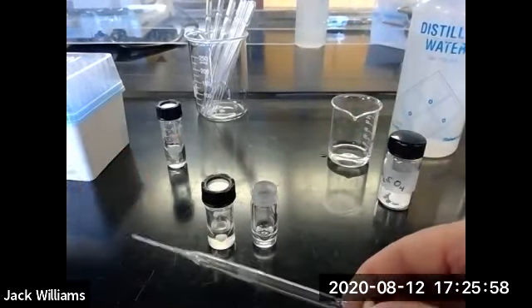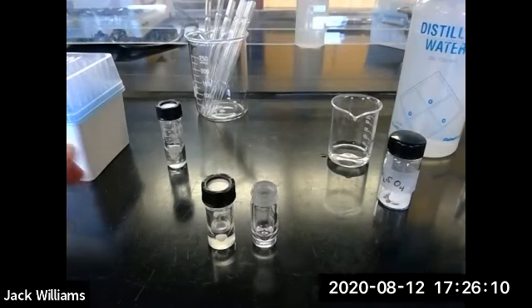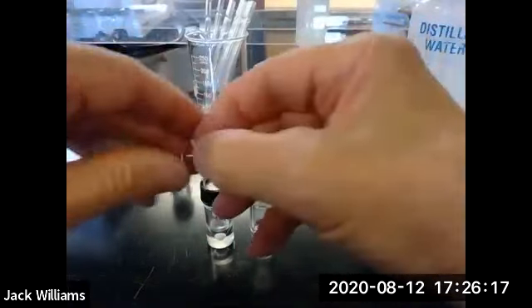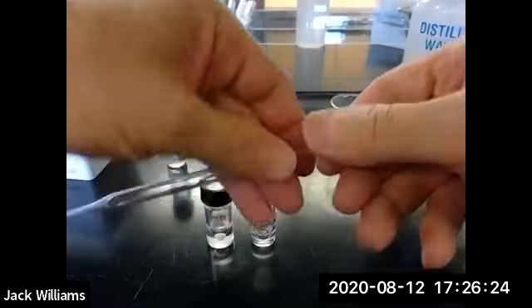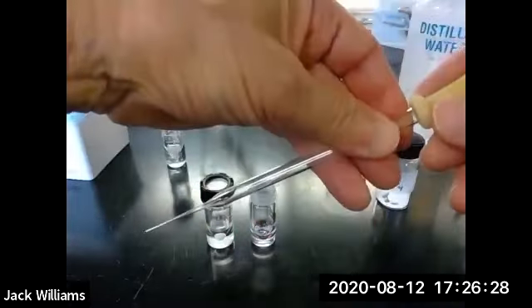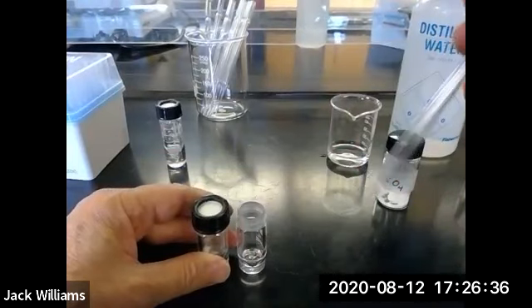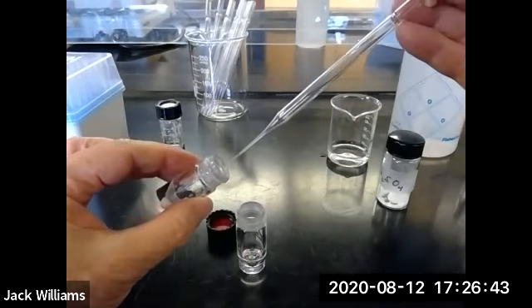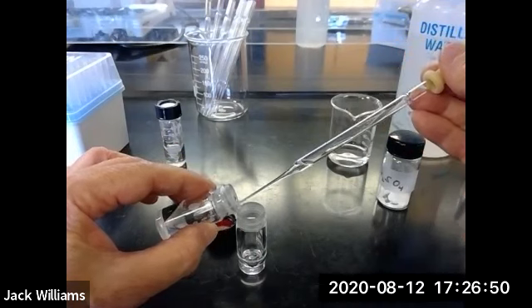We're going to use a Pasteur pipette. You should use a clean one because this has got maybe some water in there. So we'll put this into the waste beaker. Get a fresh, clean one, just be careful handling this. You're going to wear gloves. Just make sure you don't stick yourself with a corner, right? You just work carefully. You won't have a problem. Notice how I'm holding this. I'm not holding it like this, right? You hold it like this so it's pointing away from you, all right? And then put this on. All right, so we're all set to make the transfer. We're going to do this as quickly as possible because, again, you'll have a problem of this squirting out. So into the vial, up, keep some negative pressure on it, right out. Isn't that nice?